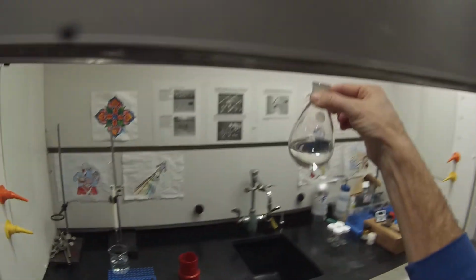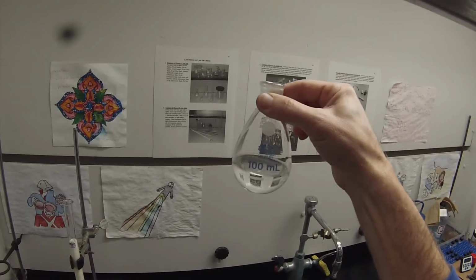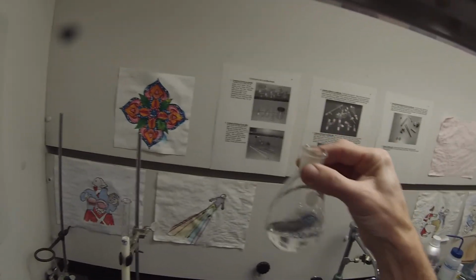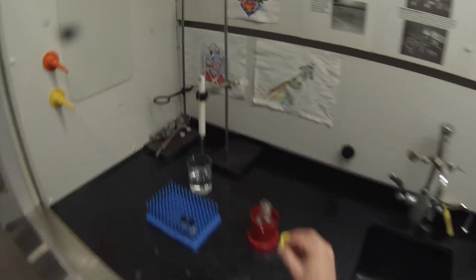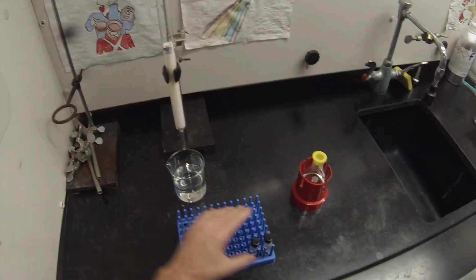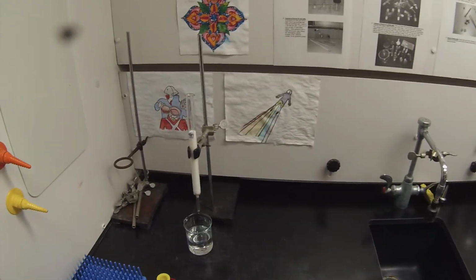So I've probably got about 40 milliliters, maybe closer to 50. Should be about 8 milliliters times 6 fractions, so 48 milliliters. And I'm going to rotovap that, but the rotovap's not set up. So I will cap that up for now. And I also have to go and get some waste containers, because there are no waste containers to pour this stuff in the back. So I'm going to go off camera and go set up a rotovap and get some waste containers.